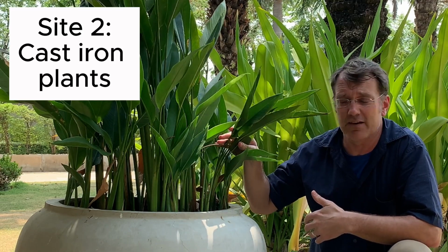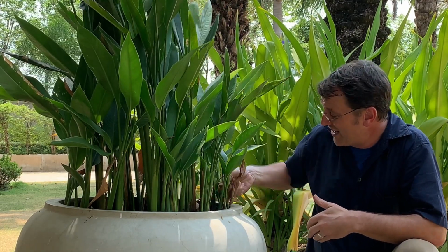The next site we've chosen to investigate is another pot full of water, but it has a different species of plant growing in it. Again, when I look in this water, I can see all kinds of things growing. I see algae, I can see little things swimming around in the water, and we want to see how the interaction of those living organisms affects the dissolved oxygen.